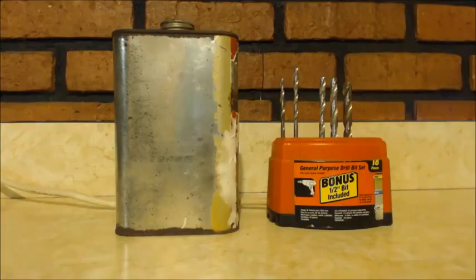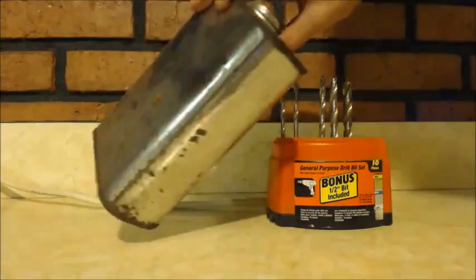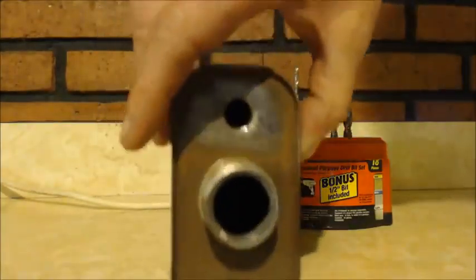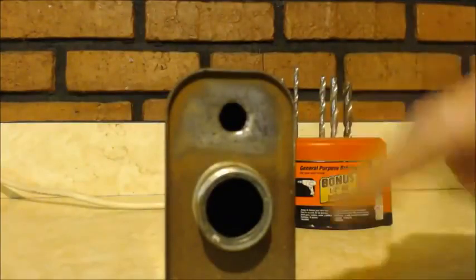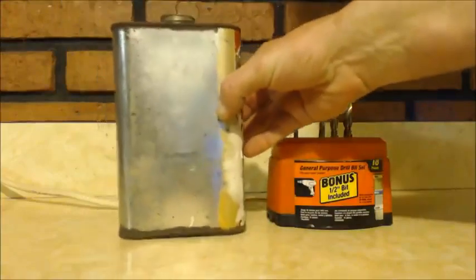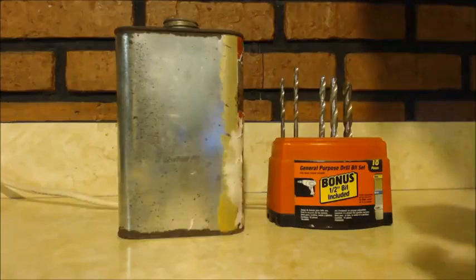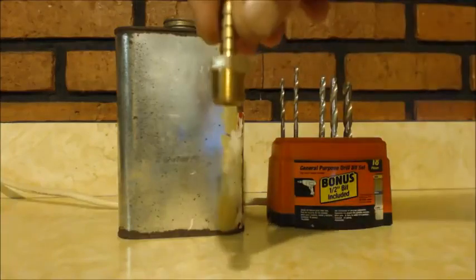Now this, you can't use this for everything. Mostly solvents. This isn't for acids, using a metal can to start with. This is basically an old acetone can, but I ripped off the label and you can see how old it is. I sanded that down. My car's been broken down since Christmas, so I'm just scavenging around the house. This is what I found.